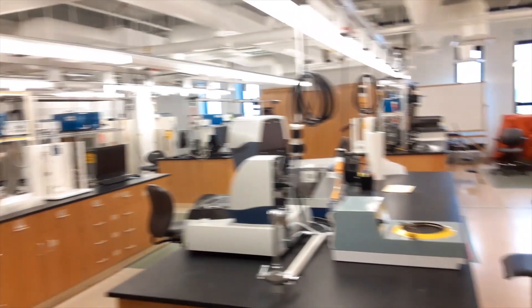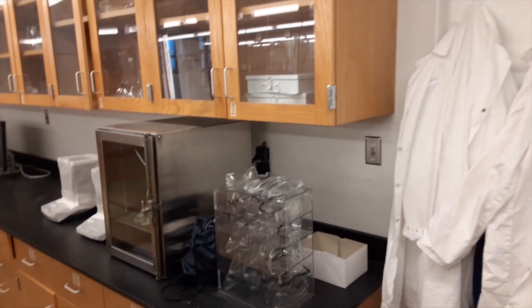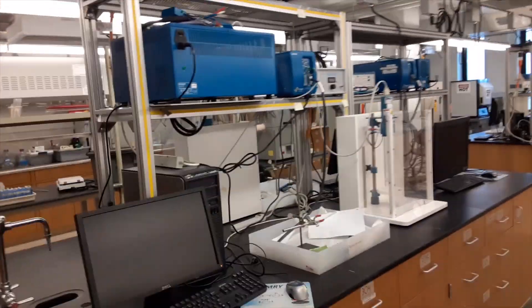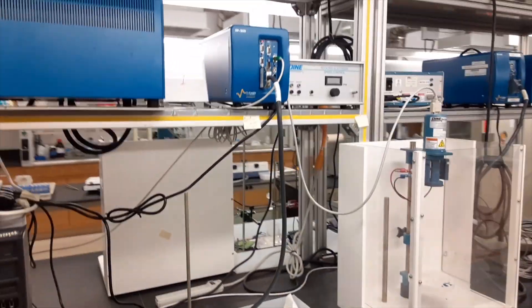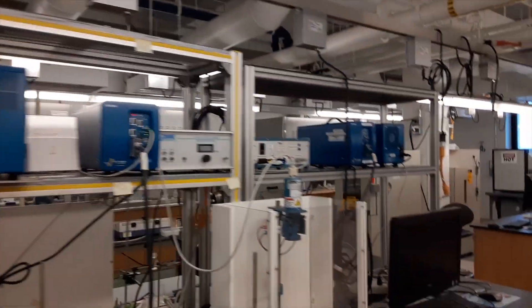Without further ado, here are the corrosion labs. As you can see, you're going to need a lab coat and some glasses if you're going to be walking around in here. This is where you're going to be doing all of your labs, whether that is linear polarization testing or weight loss testing, and you can do so much with the machinery in here.